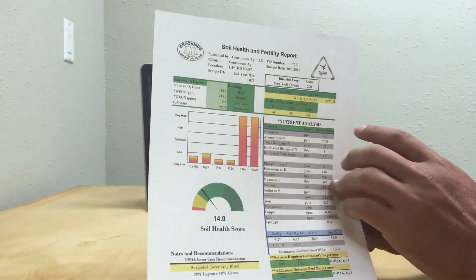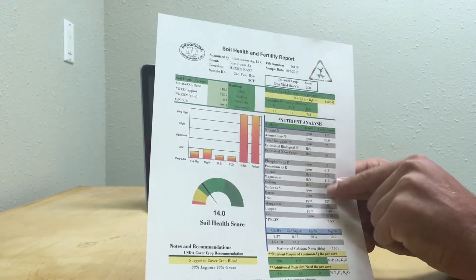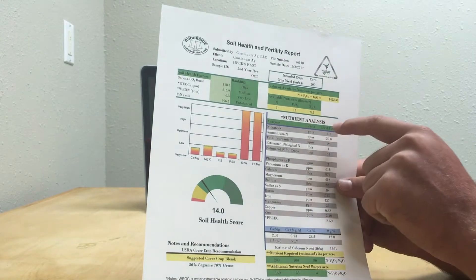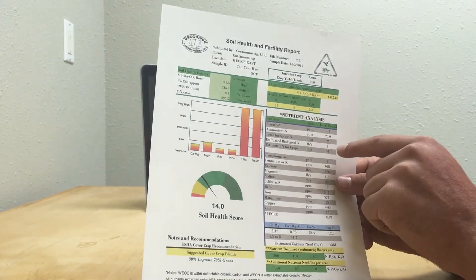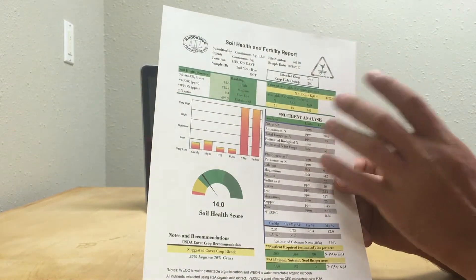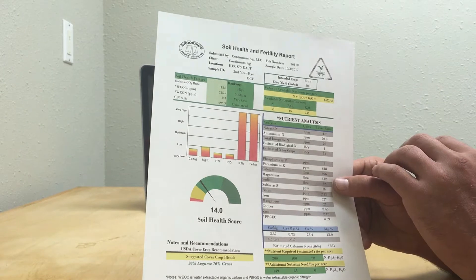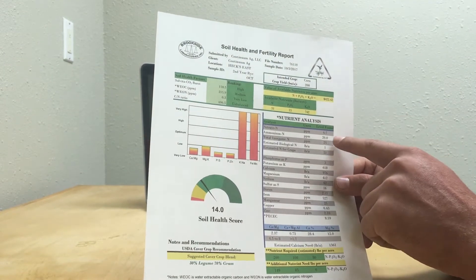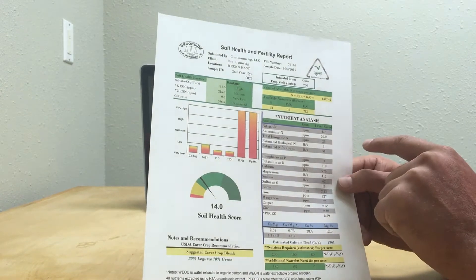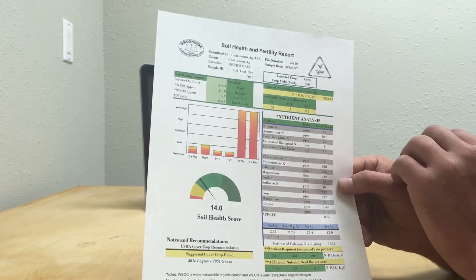On the right side of the report you'll see N, P, and K and micronutrients. I like this test because it breaks nitrogen down into nitrate, ammonium, and estimated biological nitrogen. So we're breaking nitrogen down and able to better monitor what form our nitrogen is in. Monitoring N, P, and K throughout the year has been really helpful, and we can get that from our regular soil testing as well.